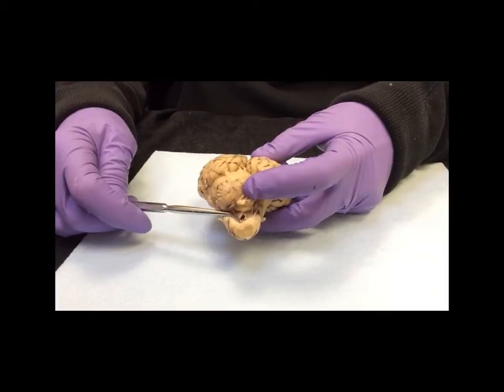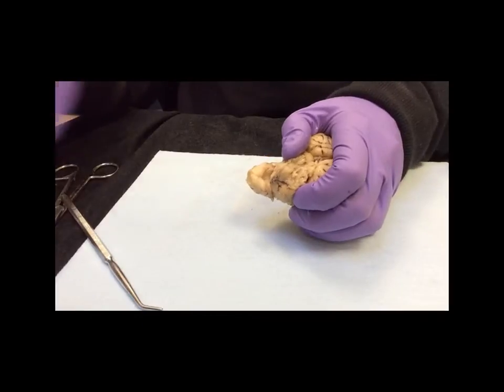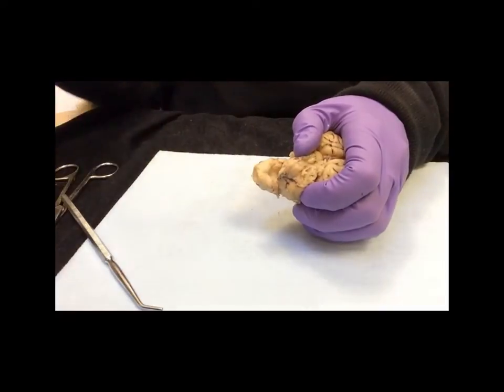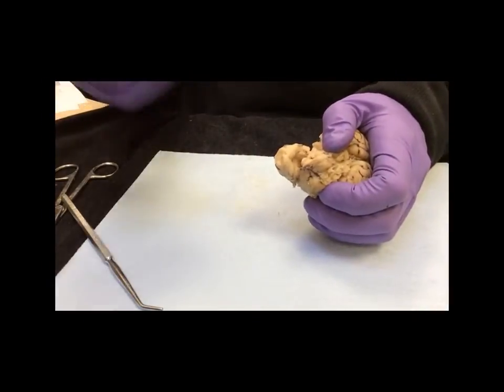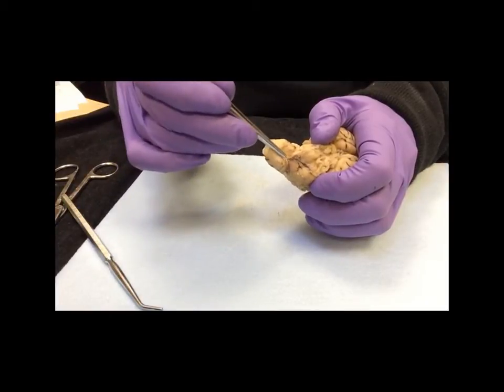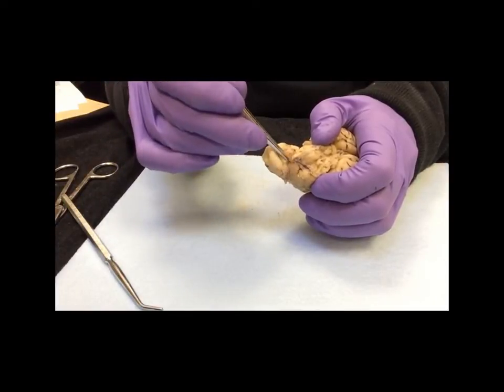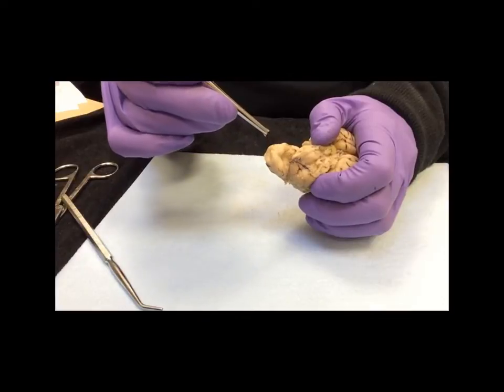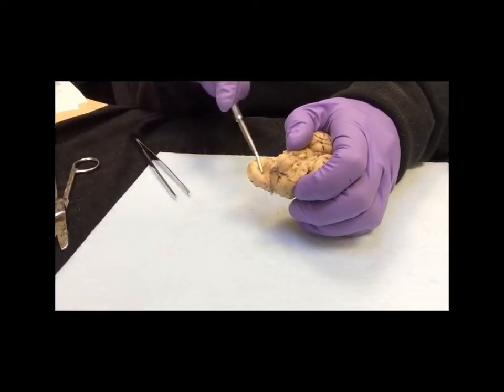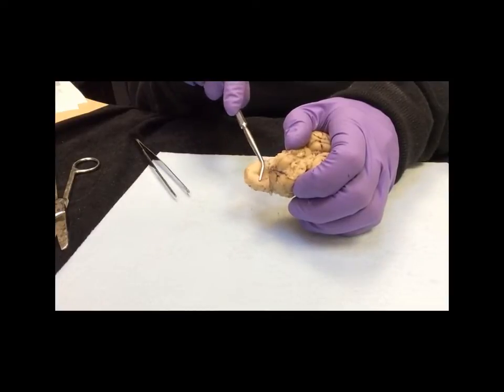That is the middle layer. Also in step 4, as you continue to pull this down, you may or may not see some blackish material right here. This is what's known as the choroid plexus, and these are the blood vessels involved in making the cerebrospinal fluid. This right here, underneath the cerebellum, is the 4th ventricle, and this little structure right here where it comes together is called the obex.